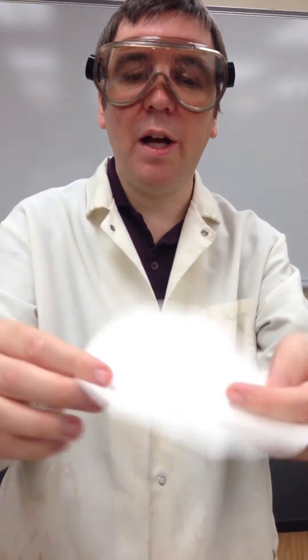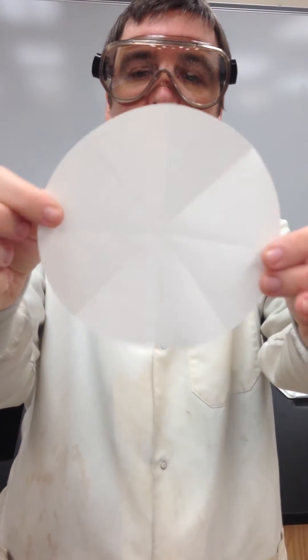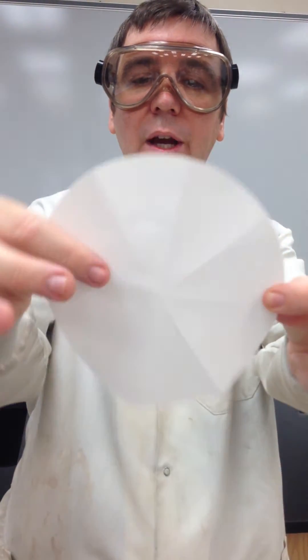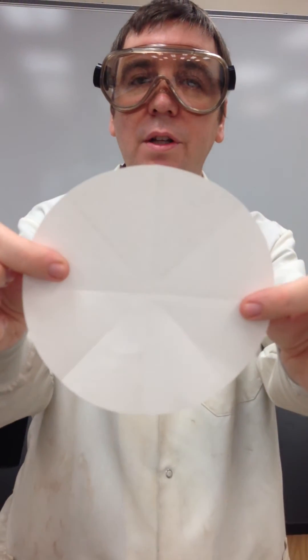At this point, I should have eight equal sectors, all with the creases pointing to the outside or the inside.